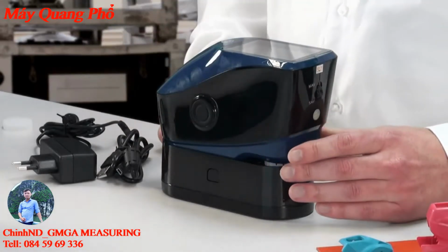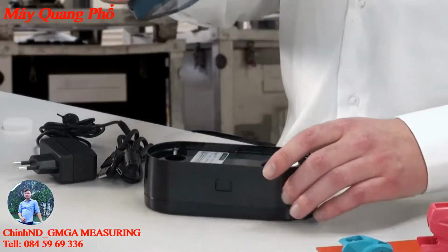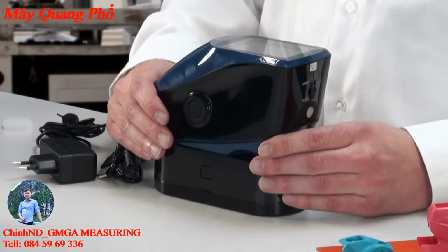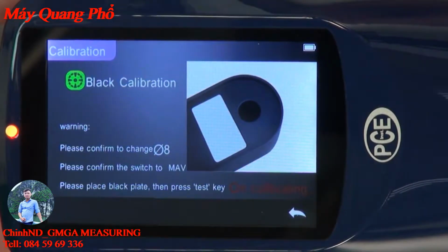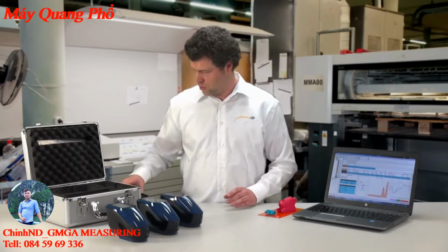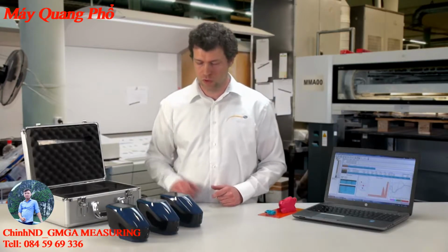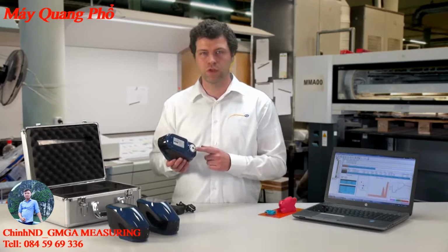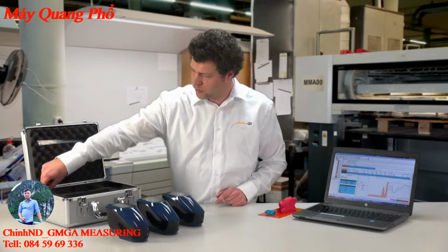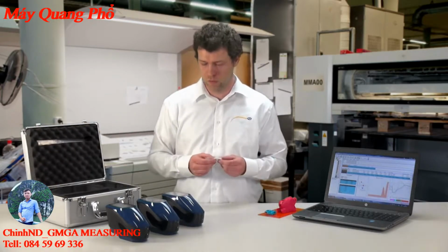The device would first be white calibrated, and the black calibration you find on the other side, which means you just have to turn a standard and calibrate the device from the other side. With the PCE-CSM 22, there is a change of equipment. That means on the bottom you can connect two different measuring openings. With this device in the delivery, there is additional equipment for 8mm and 4mm.